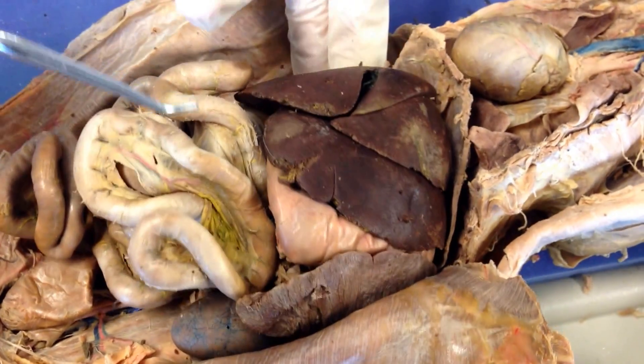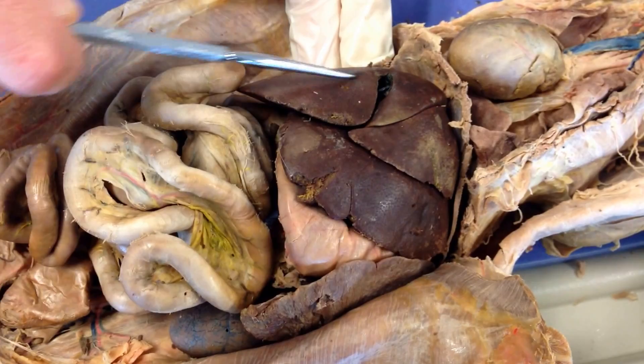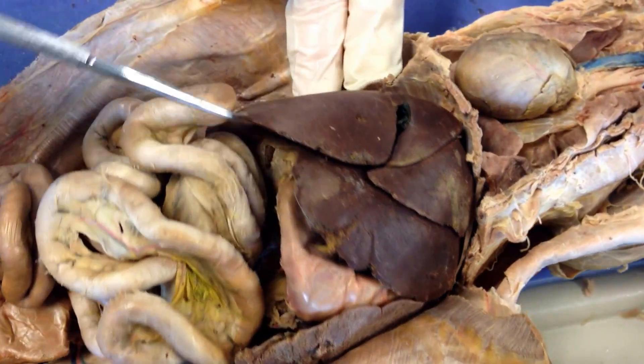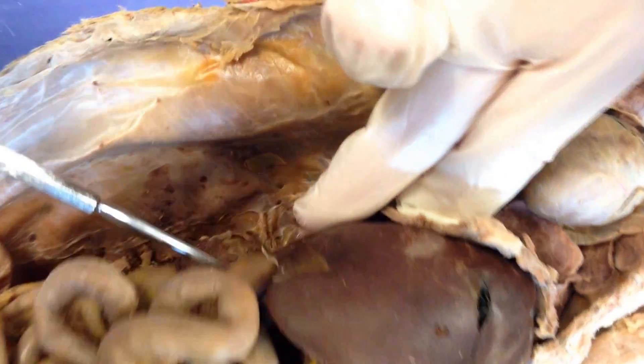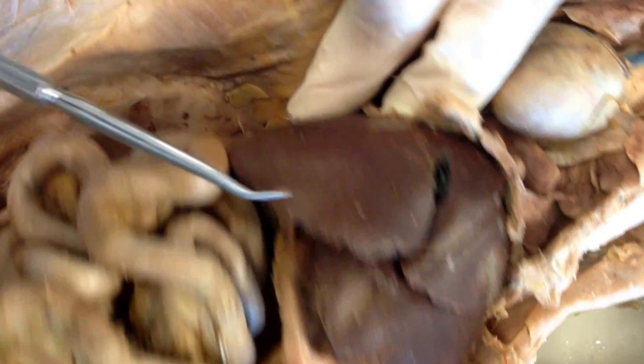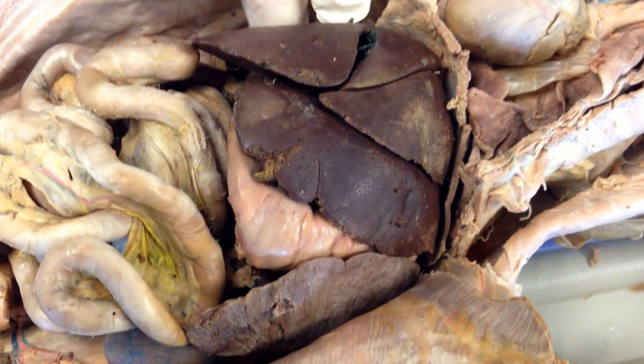Next, identify the liver. The liver is all of this — this whole big structure has got a whole bunch of lobes. In fact, there's another lobe down on the backside here, but there are a bunch of different lobes.